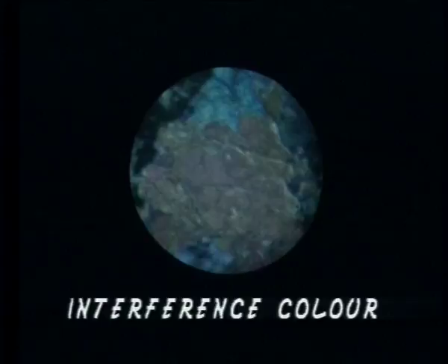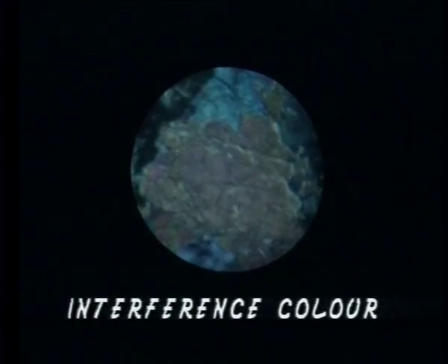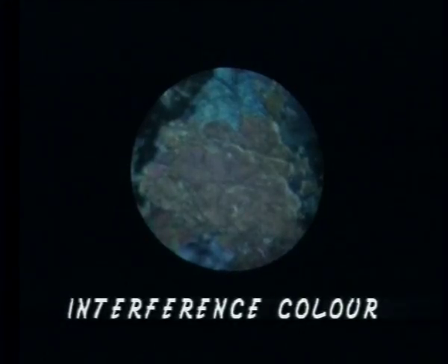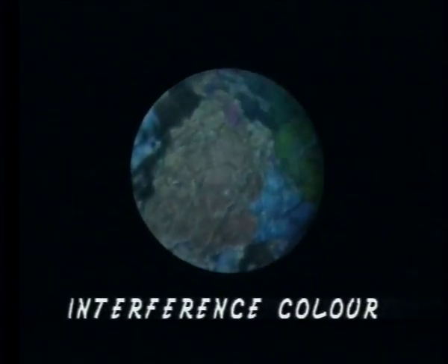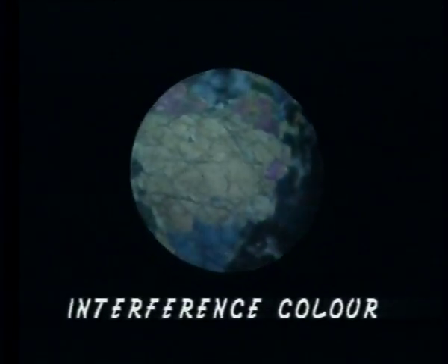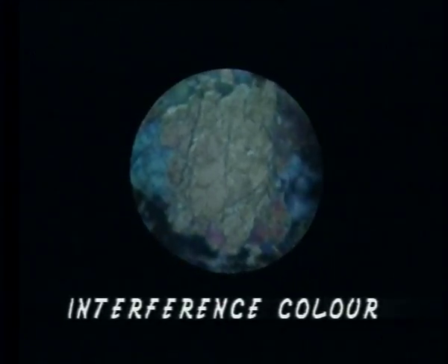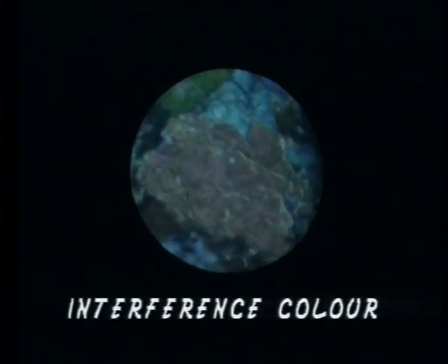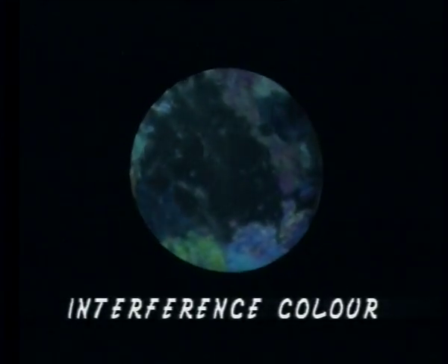In other positions, the mineral shows a distinct color. The intensity of this color is maximum at 45 degrees from the extinction position. This color is the result of interference of light rays having a definite phase difference, where the phase difference is set by and is proportional to the birefringence of the mineral. It is therefore called interference color.